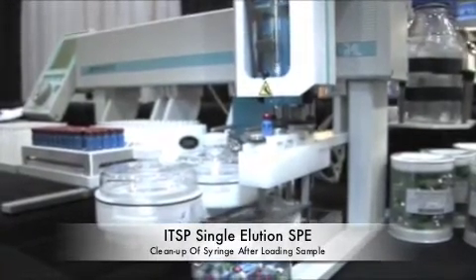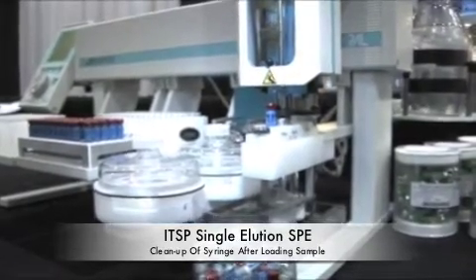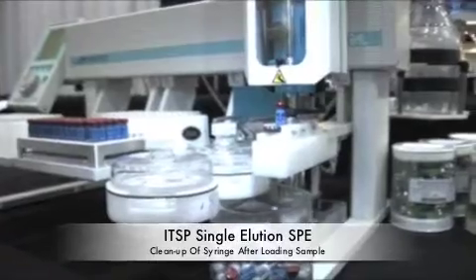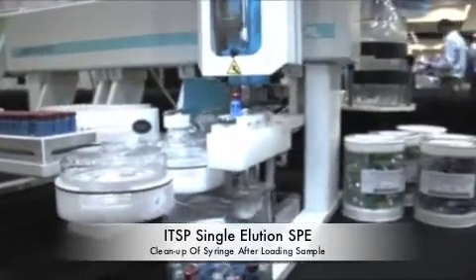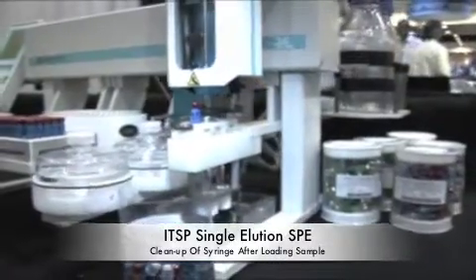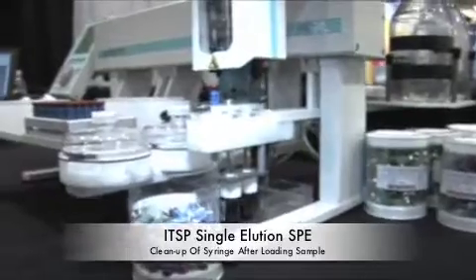What we're doing now is we've loaded the raw sample and we're cleaning the syringe. We will then pick up a solution of solvent and wash the column itself. Then once that's complete, we will load another elution solvent and then pick up the device and move it over this tray here for the final elution.